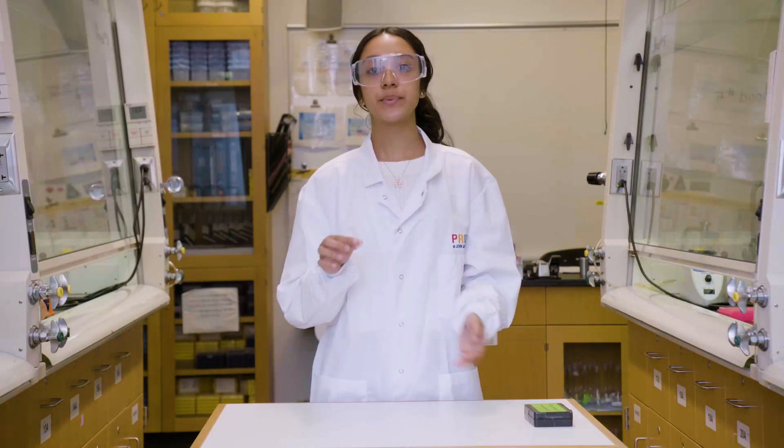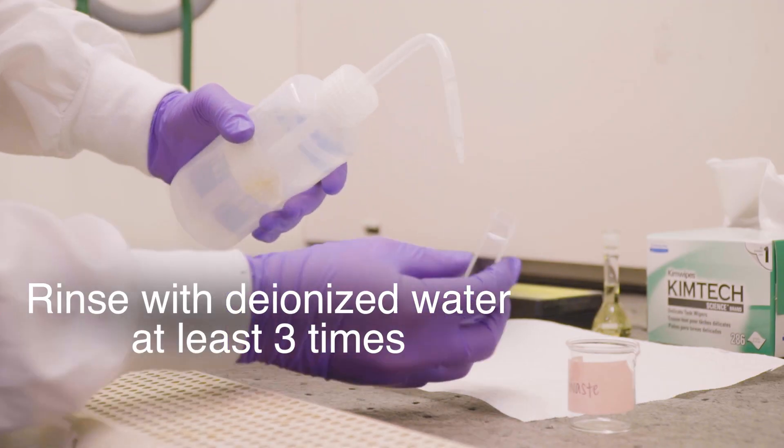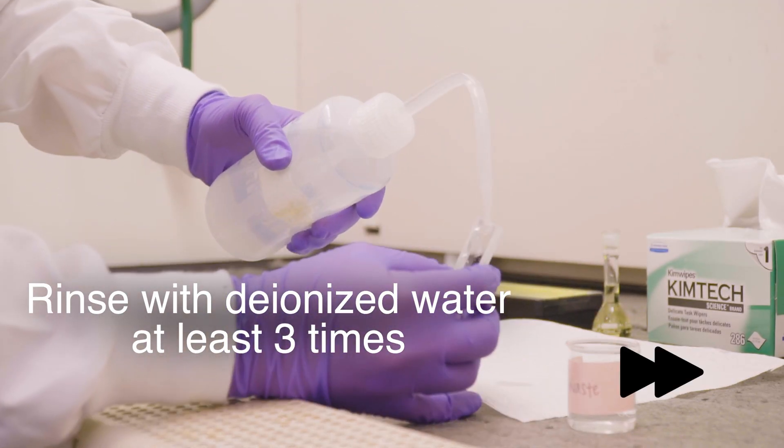Take a cuvette and rinse it with deionized water. Make sure to cover all the inner surfaces to remove any dust or contaminants.